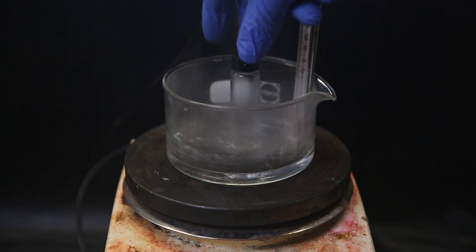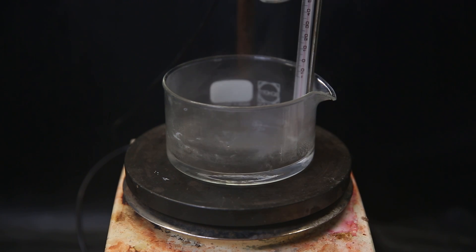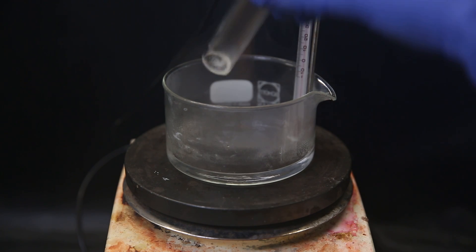When the probe reaches 140°C, it starts to melt. And when I take it out, it quickly becomes a solid again. The probe isn't perfect, and it is very unlikely to be a coincidence. So it is fair to assume we have the product here.